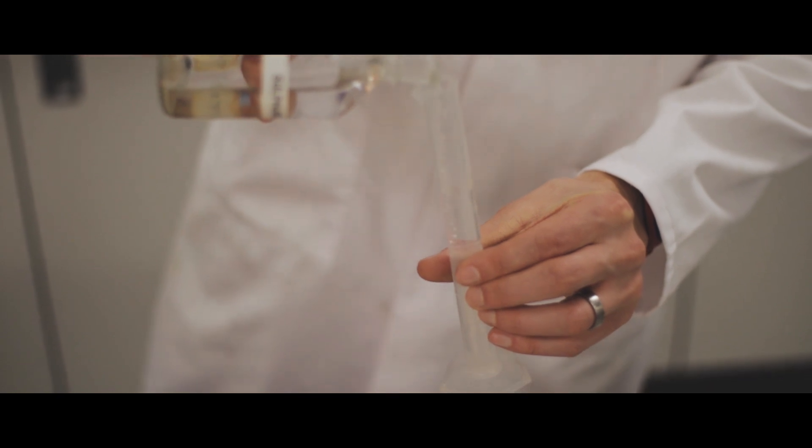So measure out 25 cm³ of sulfuric acid and place that into a beaker.